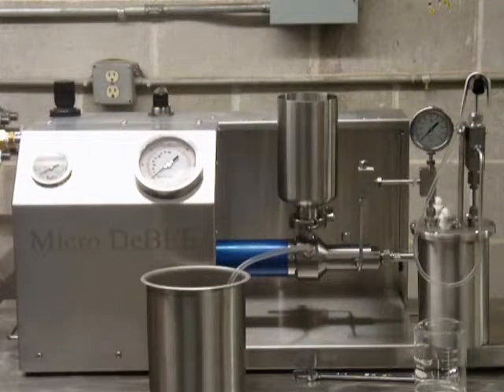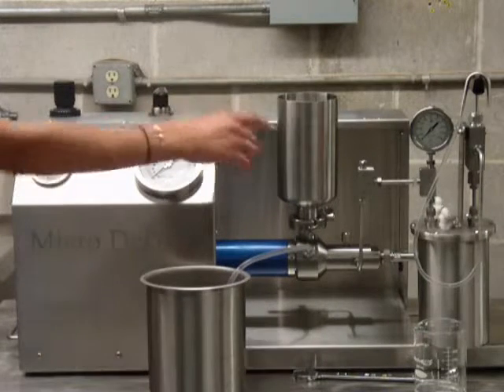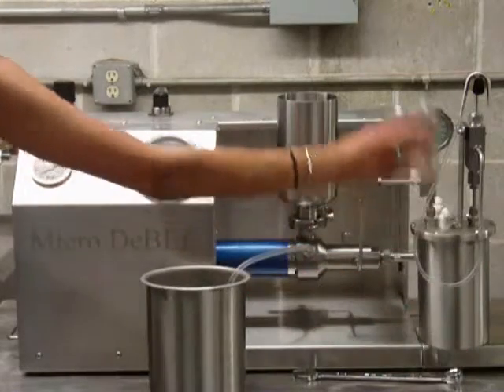The micro DeBEE should be primed when the inlet reservoir is filled for the first time, or when the inlet reservoir has run empty and air was allowed to enter the system. To do this, first fill the inlet reservoir with water or the product to be processed.